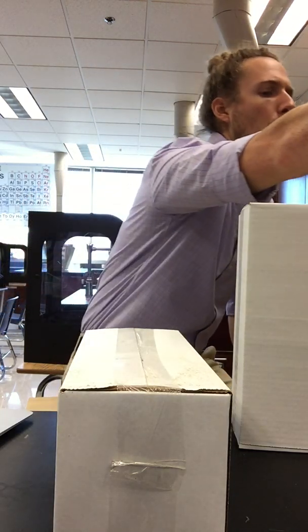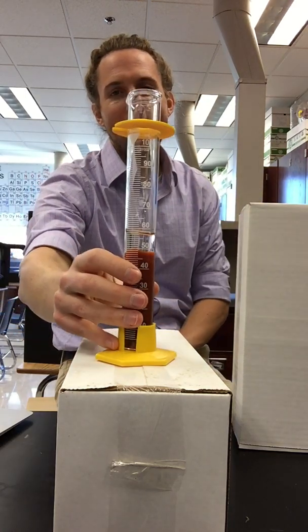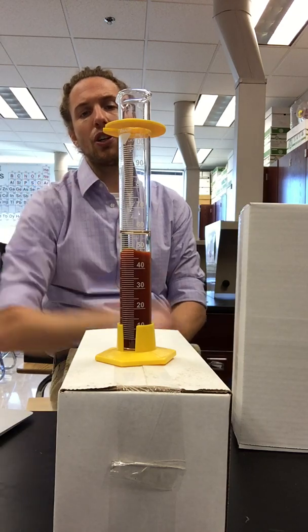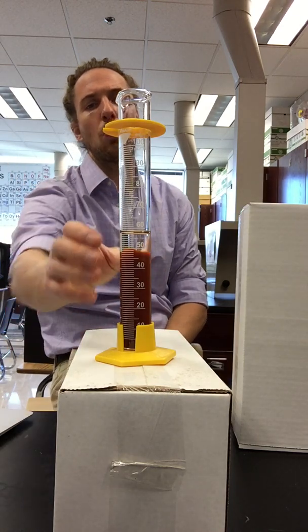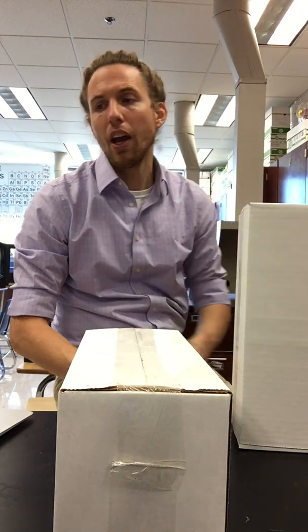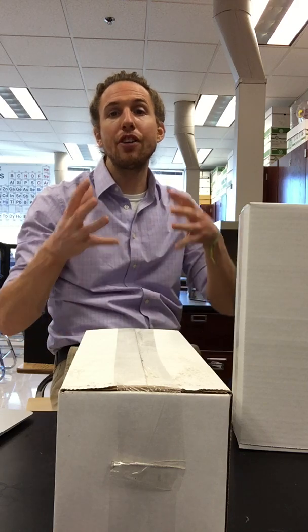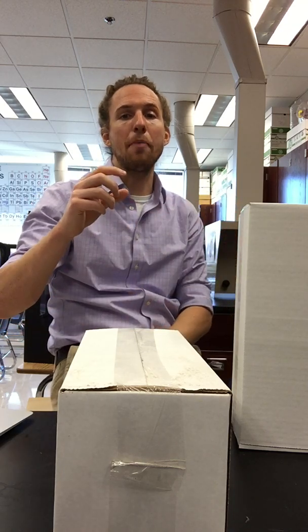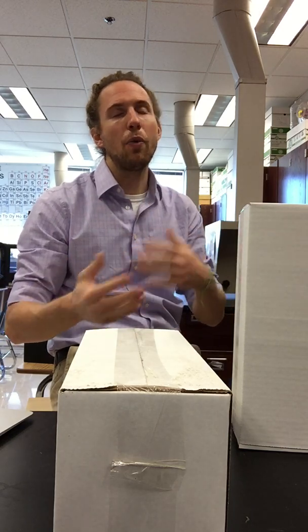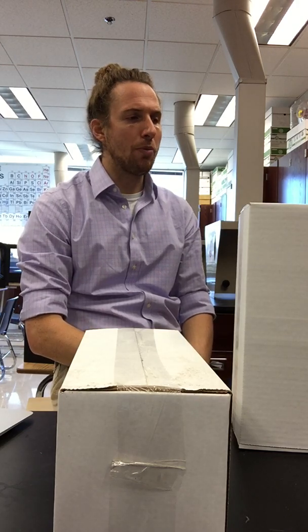For us, we're going to use some larger graduated cylinders. So for instance, here's a graduated cylinder that has the iron compound. And the reason we're using the larger ones is so that you can actually measure the volume of the precipitate in each one of these reactions. So again, you need to have out your data table. As we work through the data table, I'm going to show you all of the different graduated cylinders. I had to do this earlier in the day so that the precipitates could settle to the bottom. That's why I'm not doing the reactions right in front of you. We did them earlier. But with those settled precipitates, I need you to record the volume of said precipitate.